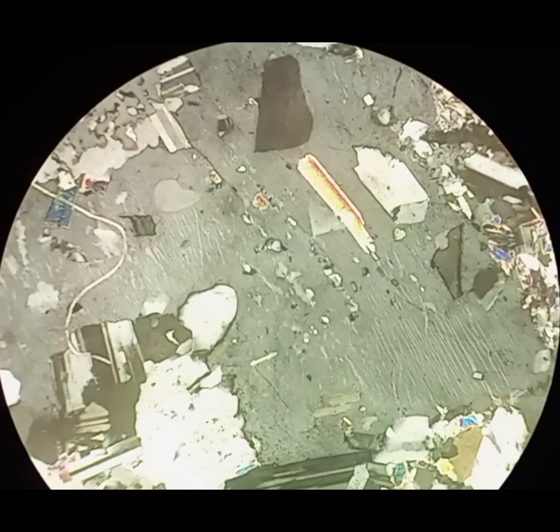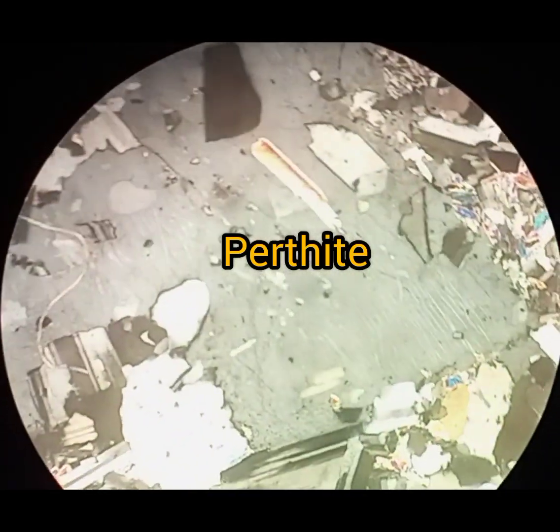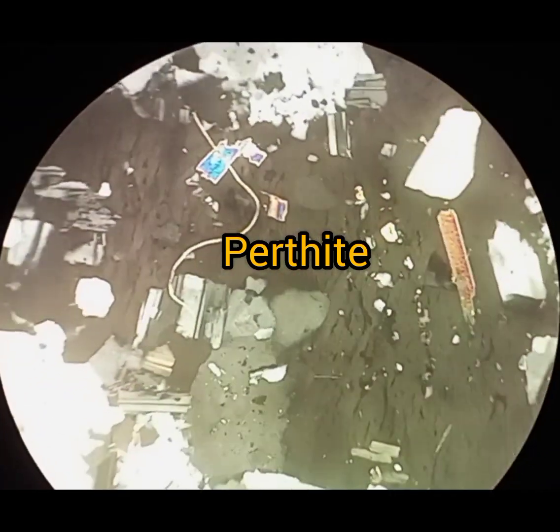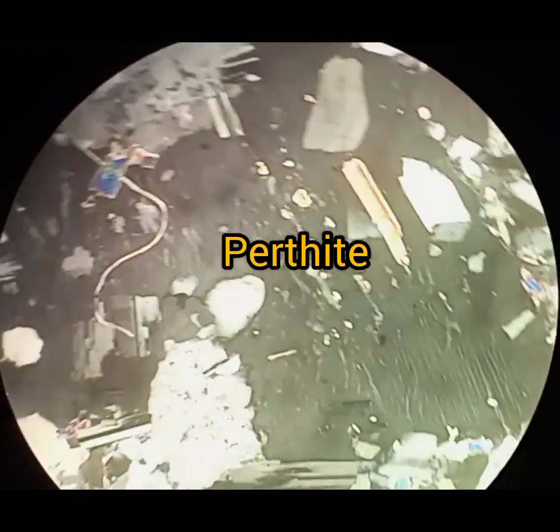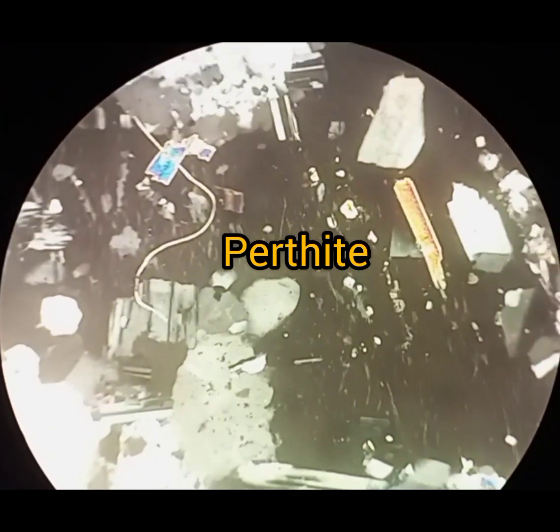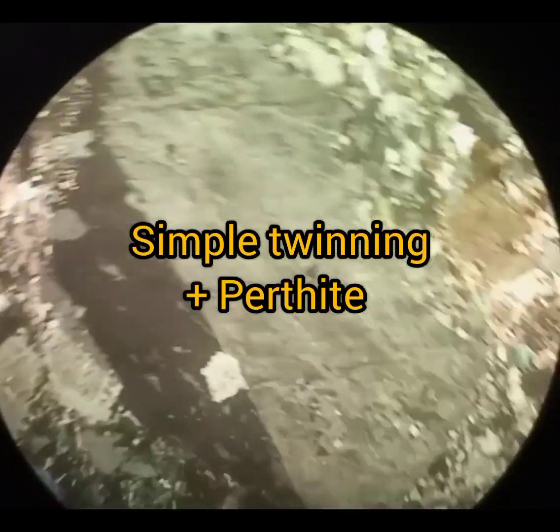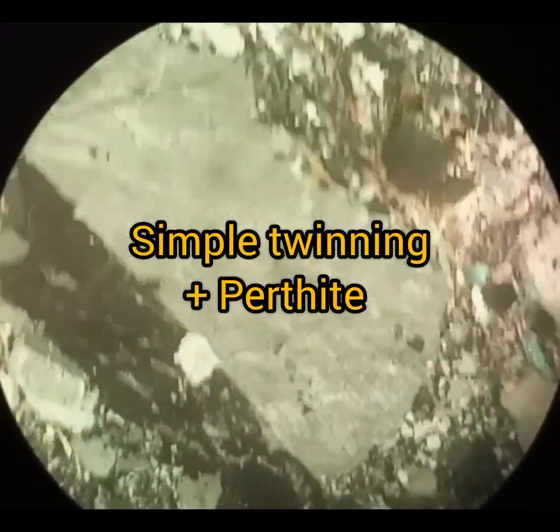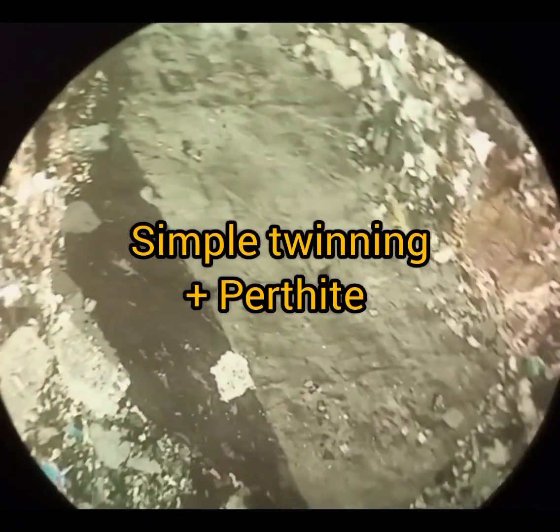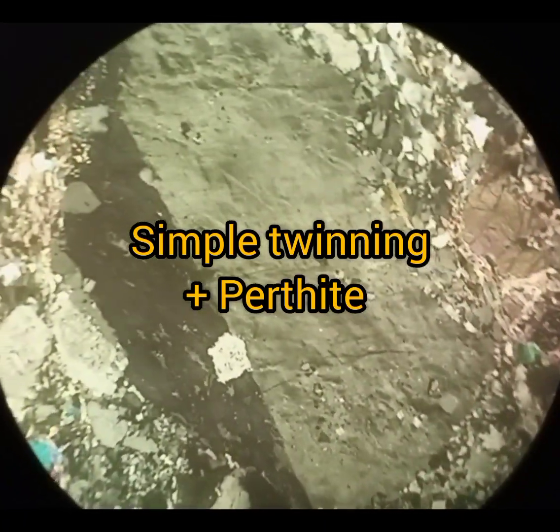This grain of orthoclase contains lamellae of albite, producing perthite twinning. This is a combination of simple twinning observed in sanidine and perthite twinning of orthoclase.